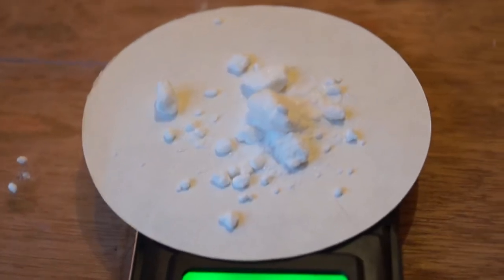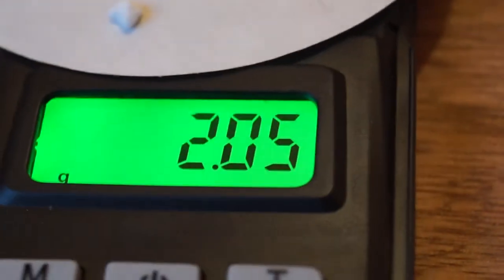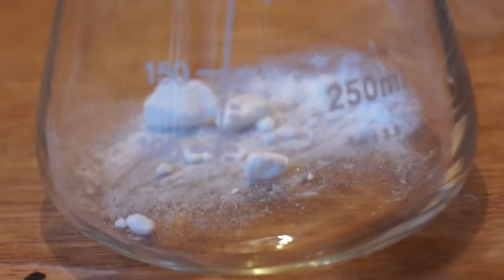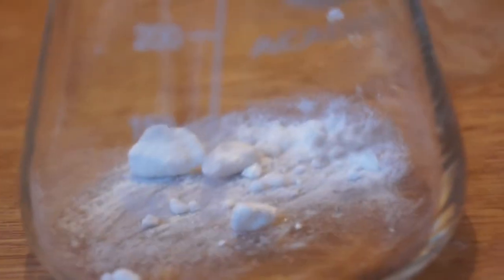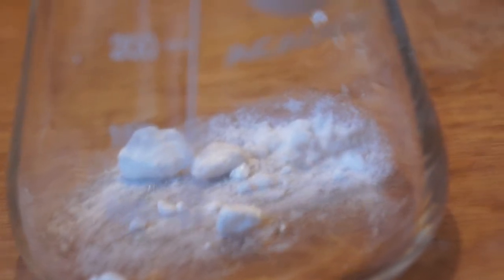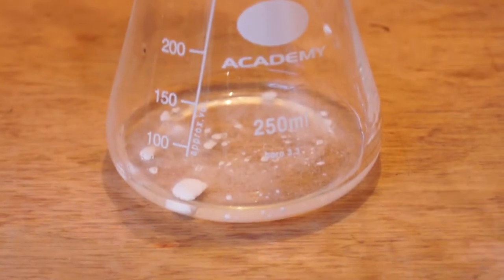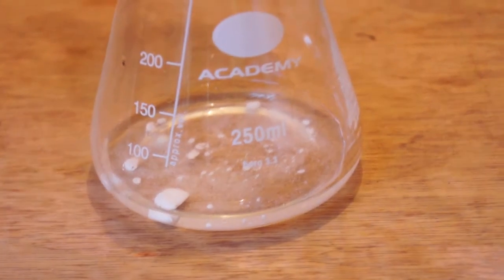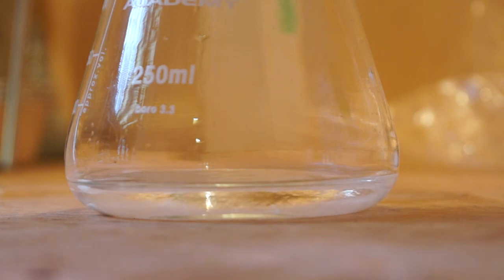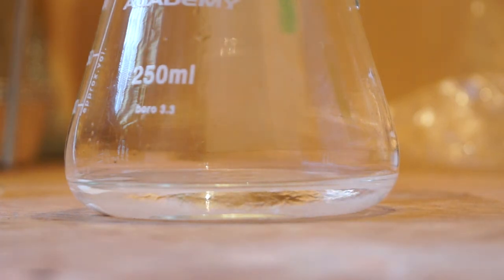First, weigh out your salicylic acid and add it to an Erlenmeyer flask — I am using approximately 2 grams. Then add excess acetic acid and a few drops of sulfuric acid, which will act as a catalyst for the esterification reaction.